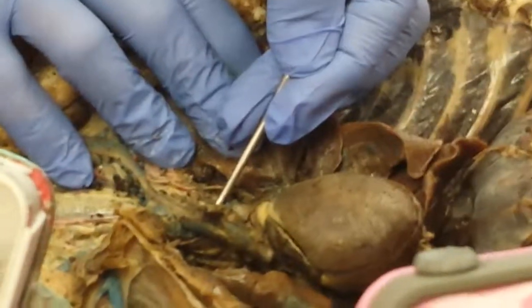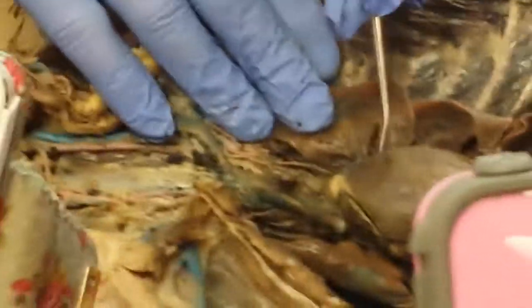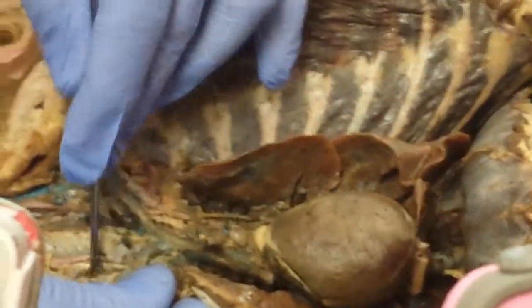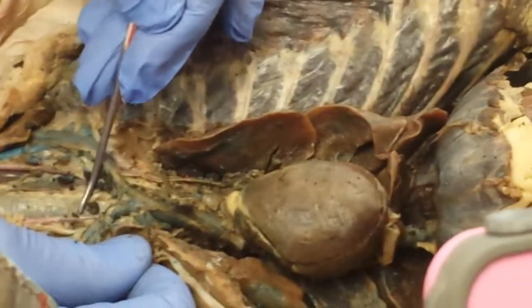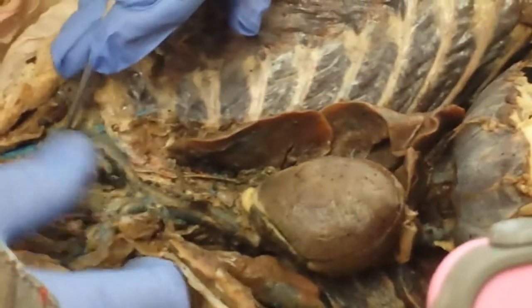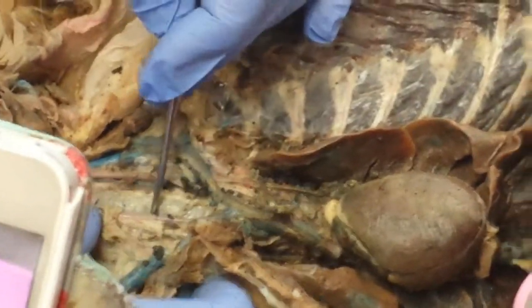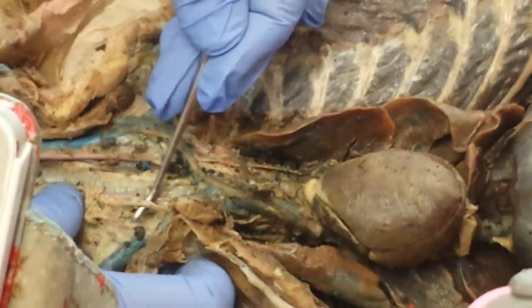Why is it called brachiocephalic? Because it goes to the arm, brachial, and cephalic, head. The first main branch here, the brachiocephalic artery, gives rise to what? You have right subclavian artery, right common carotid artery, and left common carotid artery. What you want to know when you look at the common carotid artery, because it's so conspicuous, I want you to identify the vagus nerve.